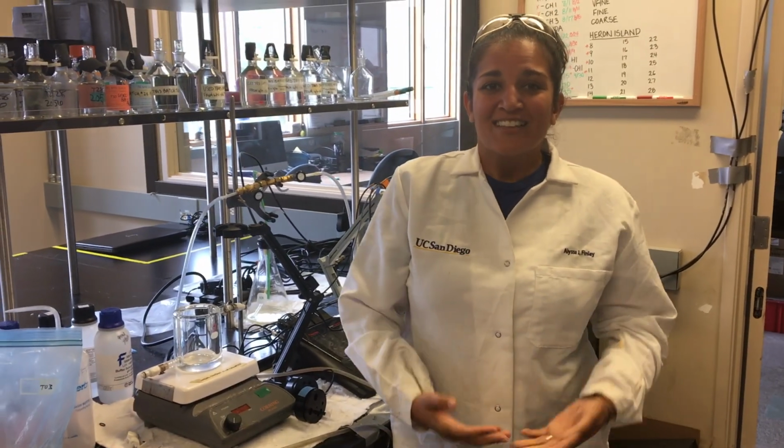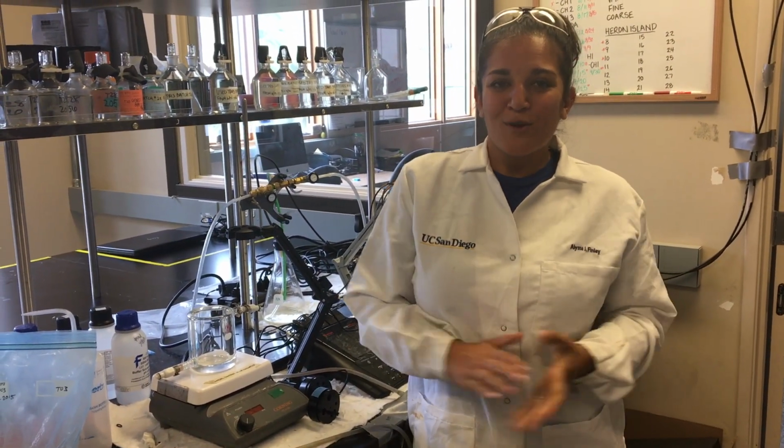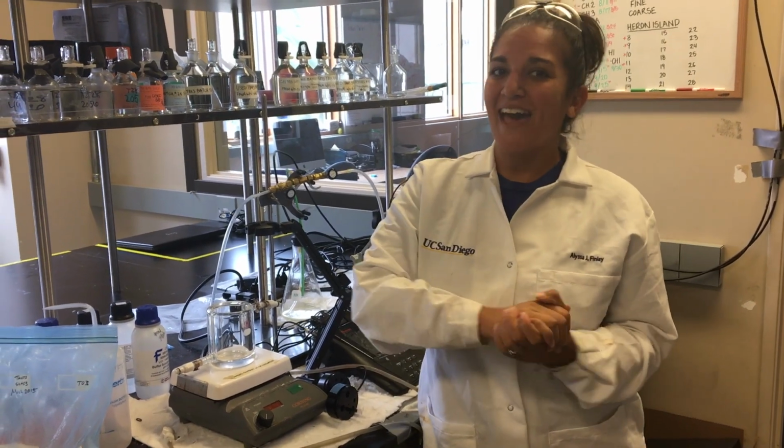And now I'm gonna send you over to our postdoc to give you a little tour of the rest of the lab.